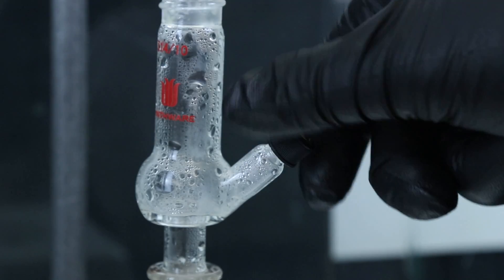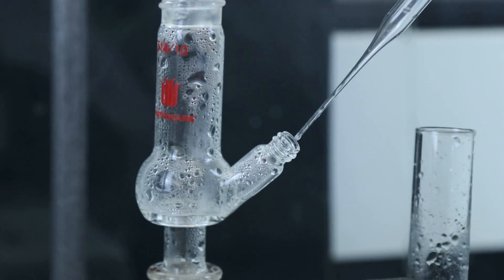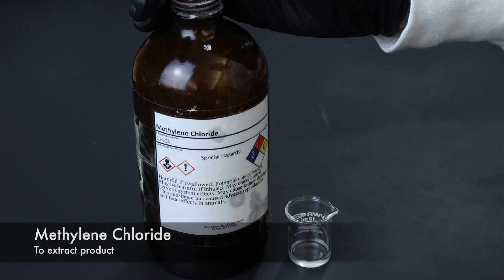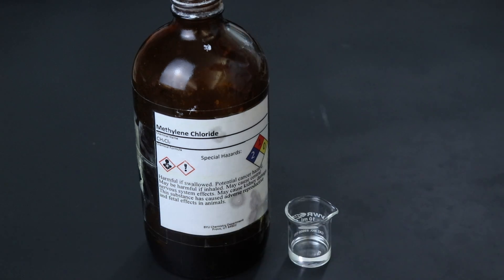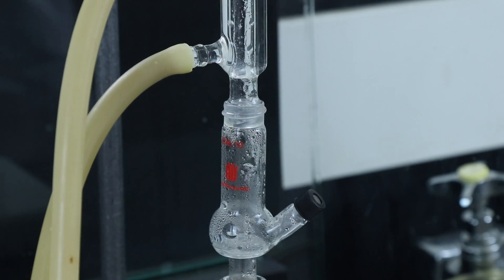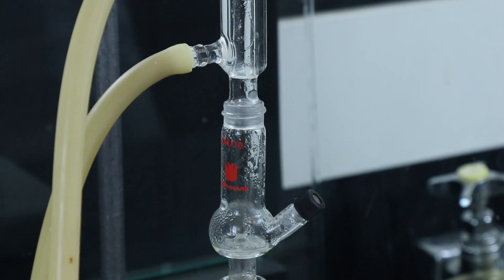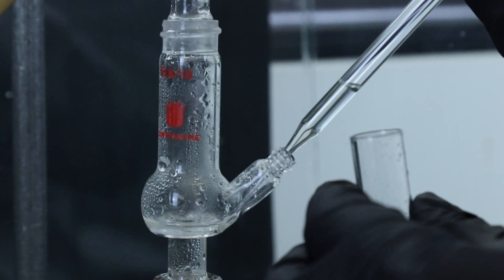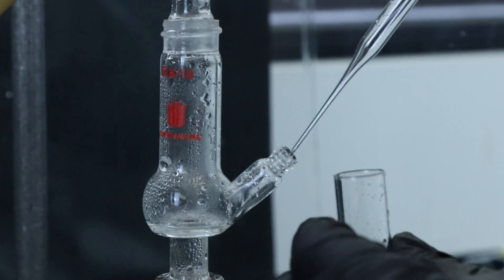After doing this about eight or nine times over 20 minutes I think I'm on the last one and it should match up with the water level. Now I'm good to move on so I'm going to start getting some methylene chloride to do the extractions, but before adding it to the test tube I'm going to rinse the apparatus to collect any cinnamaldehyde that would be adhering to the glass surfaces. Then I'll just remove that from the Hickman still and add it to the test tube containing the distillate.